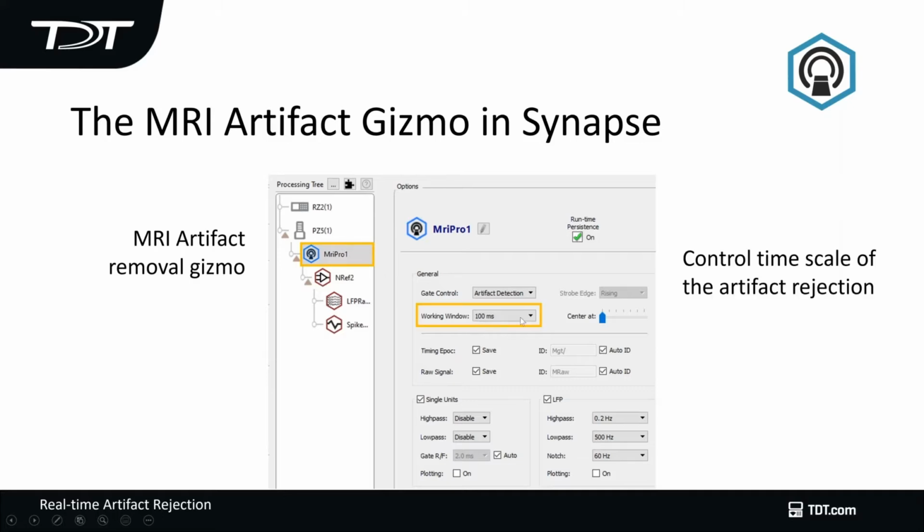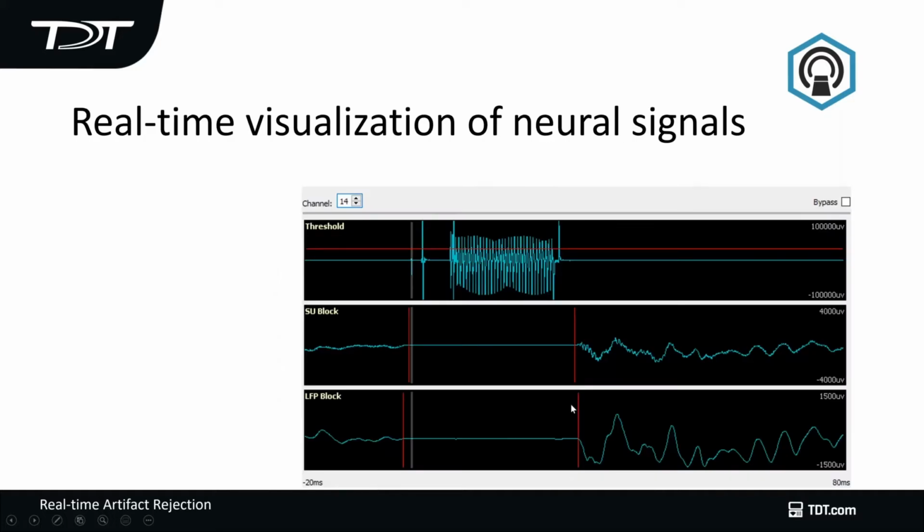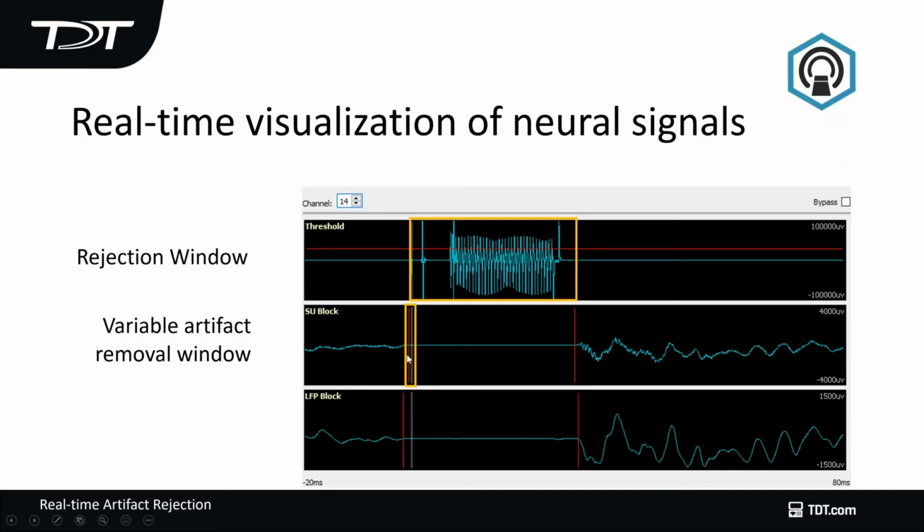Here we have a working window that you can change that's going to allow you to scale the area where you have your scanner artifact. You're going to be able to save the raw signal for offline analysis, and you have the ability to save your signals for either single units, local field potentials, or both. Here we have set our threshold. Here's my rejection window. And these are the two variable artifact removal windows that allow me to scale where my artifact is and then look at the signals around it.